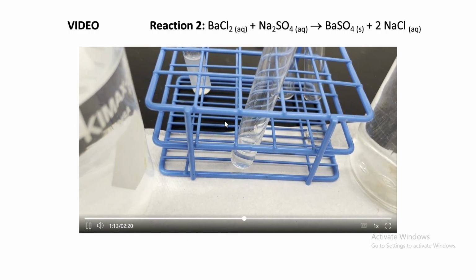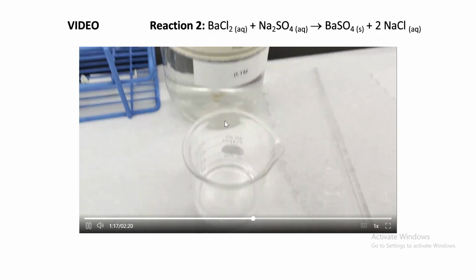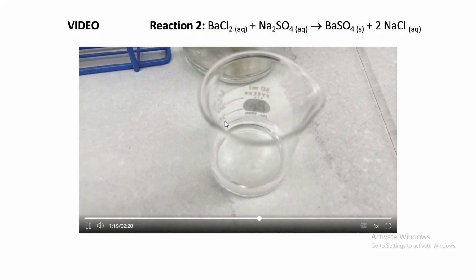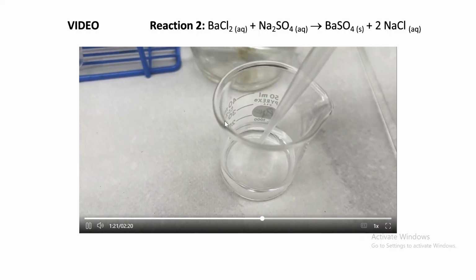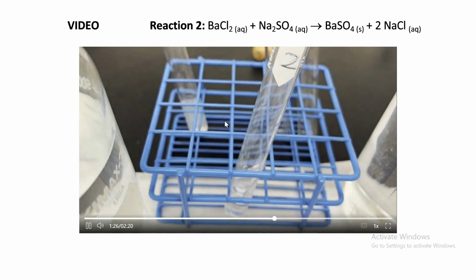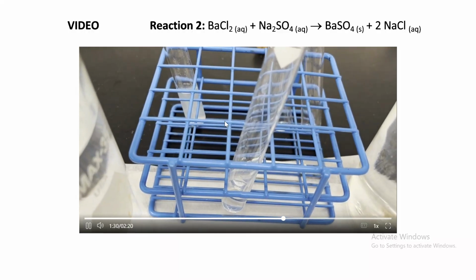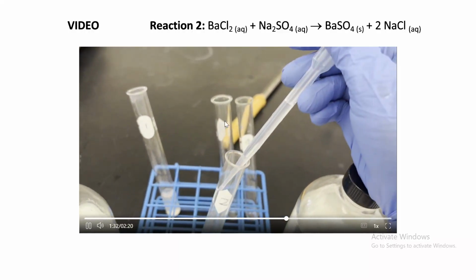And now let's see what's going to happen when we add the sodium sulfate. Another clean pipette. Take some of the sodium sulfate, add it to the test tube, and watch what happens. Let's see.